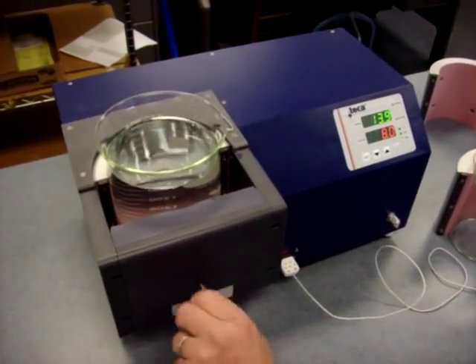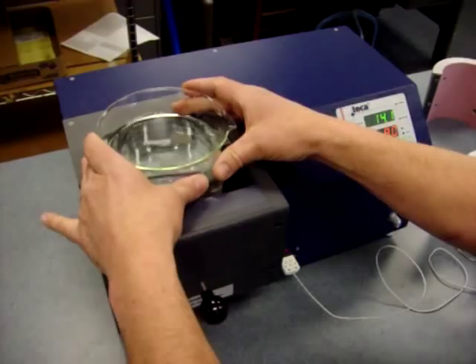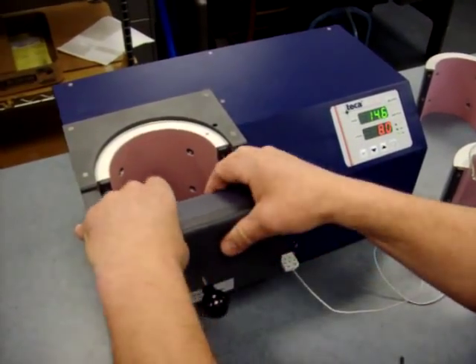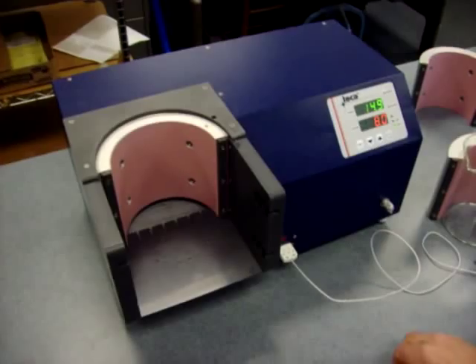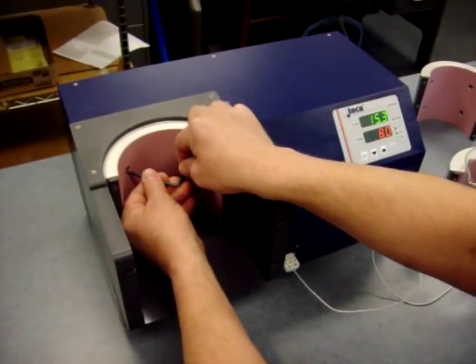First we unscrew the clamp. You can lift your beaker right out, take the front panel off, and now I'm going to remove these four screws.